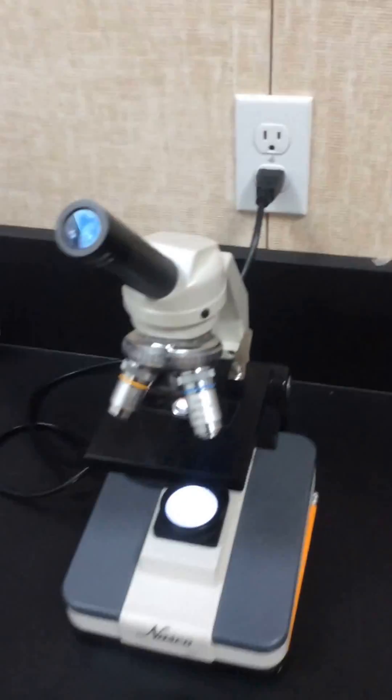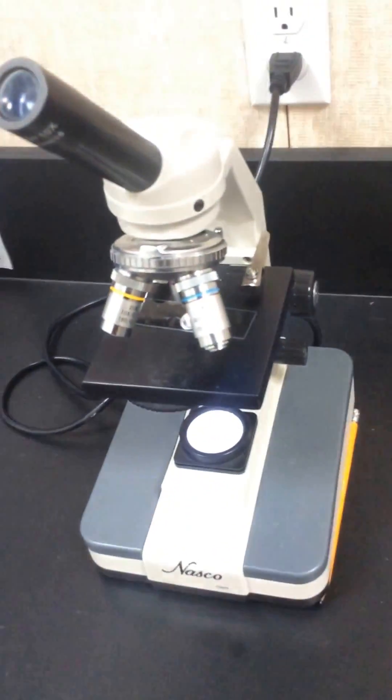So that's how I found it would be a convenient way to take pictures of your microscope specimens.